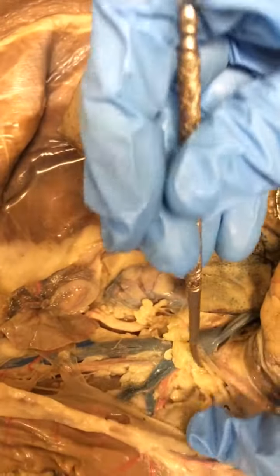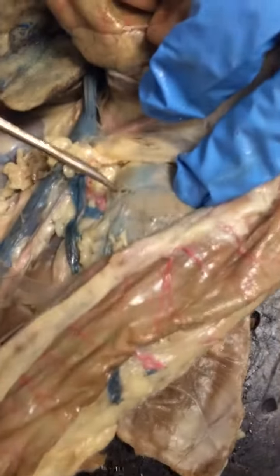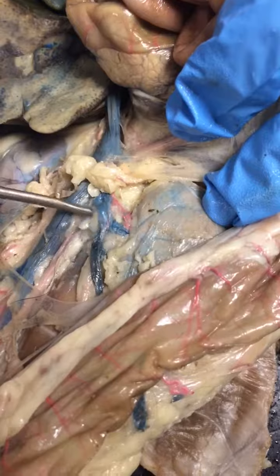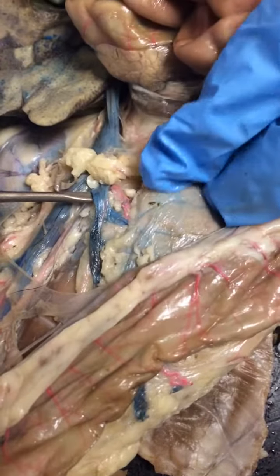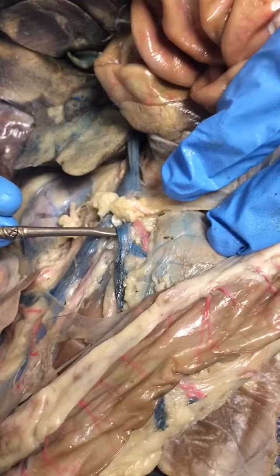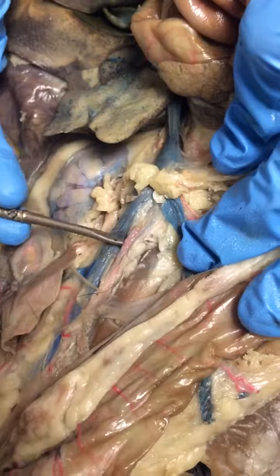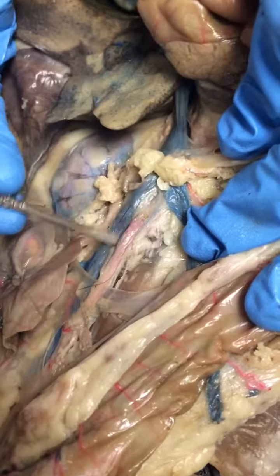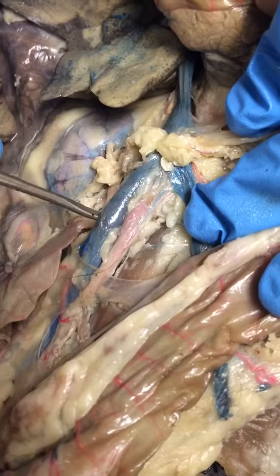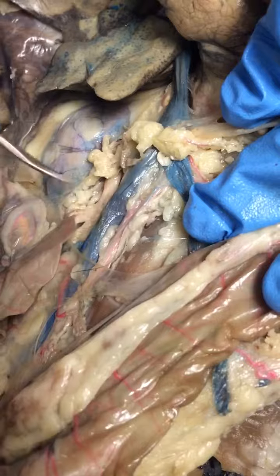One of the things you can actually notice, if I move this away, here's your kidney. All right, kidney. Right here, this vein and artery group, this is the renal vein in blue and the renal artery in red, okay? And then you can actually see connecting to all that right here, this is your dorsal aorta. So they run right by each other. Posterior vena cava, dorsal aorta, okay? You can see those being lifted up.